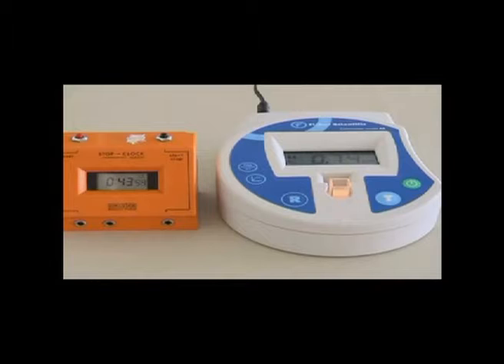We will run this experiment for 5 minutes, and you should take readings every so often, once every 30 seconds or so is recommended. Just make sure that you keep a record of the exact time that the reading was taken. What you can then do is plot a graph of the reading on the colorimeter, absorbance units, on the y-axis, against the time since the beginning of the experiment on the x-axis.